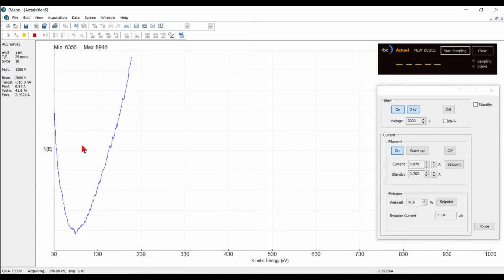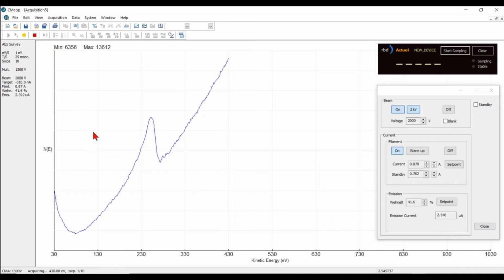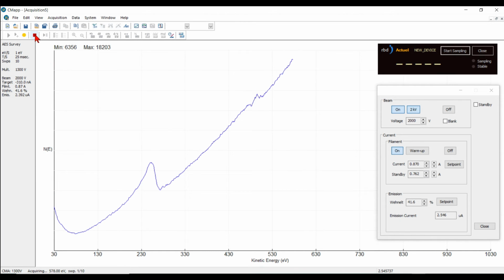Okay, so you can see I'm getting data. I'm on just the sample mount, which is very dirty. Usually has carbon on it, because we don't sputter it. So that's what I'm seeing, just basically a carbon peak. Alright, so let's go ahead and stop this acquisition.